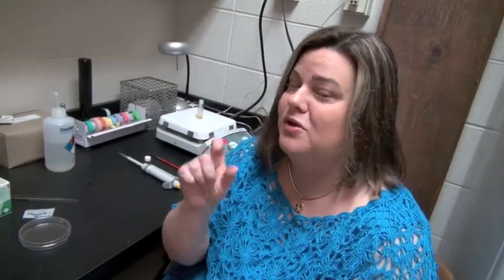One thing that a humid chamber is good for is to help you save antibody. Antibodies are very expensive, on the order of four to five hundred dollars per bottle, and the bottles are very small. So anything you can do to save antibody is going to be helpful. One thing you can do when staining is construct what's called a humid chamber.